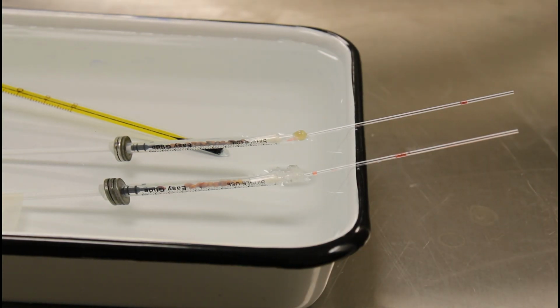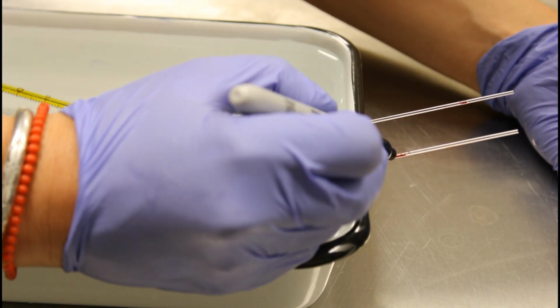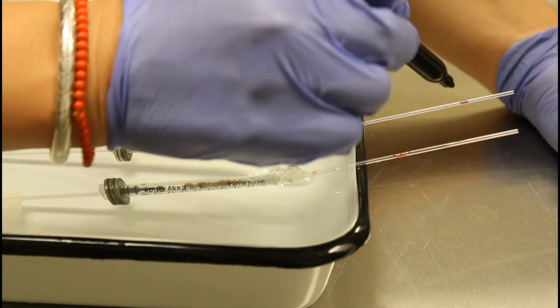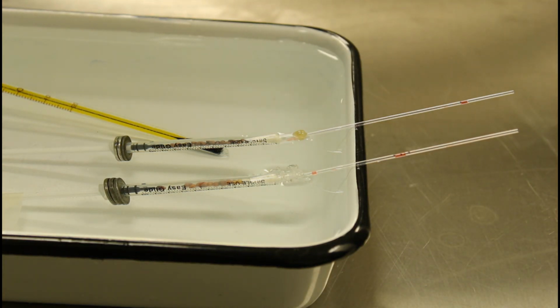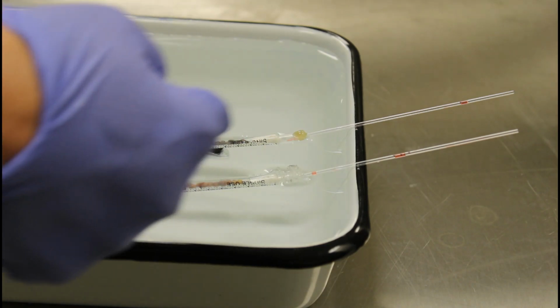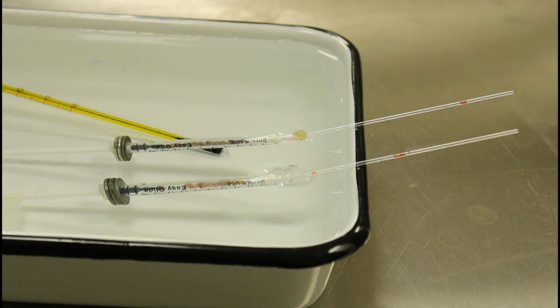Okay, so it's been just about 10 minutes since we put the manometer fluid in the capillary tubes, and I can see that the bottom of the fluid line has shifted once again. So I'm going to put a dot at the bottom. This one still hasn't moved. So the water temperature is staying steady at about 26 degrees Celsius, which is good. So we're not seeing any change in volume as a result of a change in temperature. We're seeing a change in volume as a result of cellular respiration occurring here in the respirometer with the living seeds. We're not seeing any change so far in our control. So we will check in on this again in 5 more minutes. So that will be when we make our mark for our 15-minute time interval.